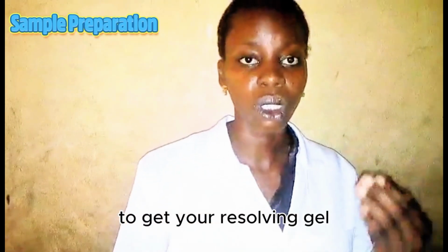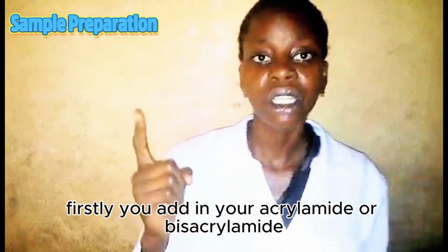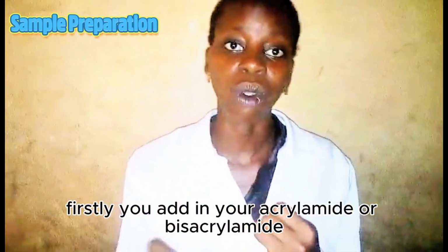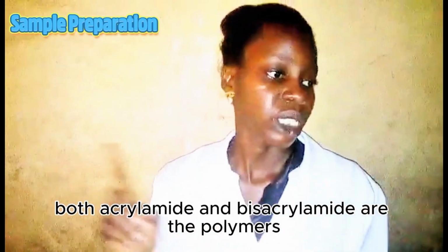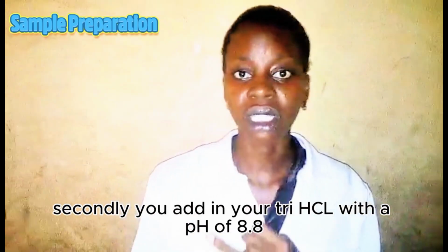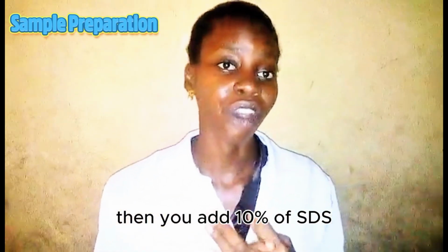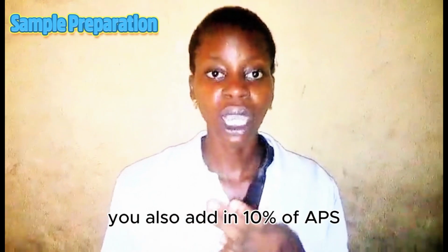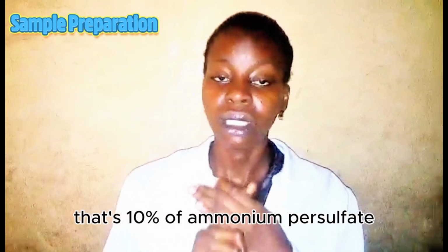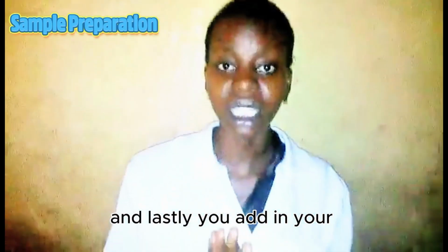That's how to make your resolving gel. Firstly, you add in your acrylamide or bisacrylamide. Both acrylamide and bisacrylamide are the polymers. Secondly, you add in your Tris-HCl with a pH of 8.8. Then you add 10% SDS, that's 10% sodium dodecyl sulfate. You also add in 10% APS, that's 10% ammonium persulfate, and lastly you add in your TEMED.